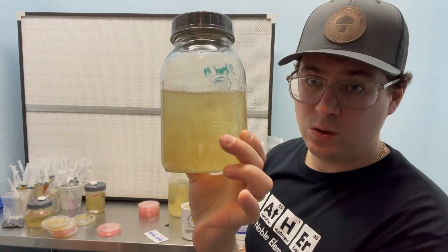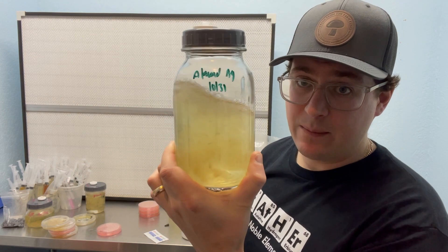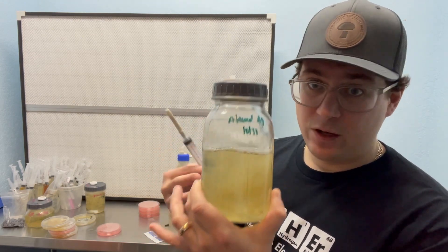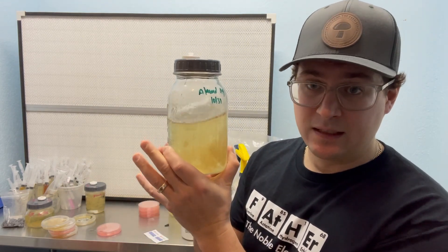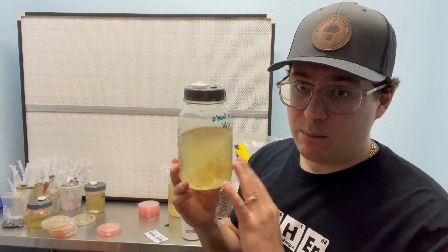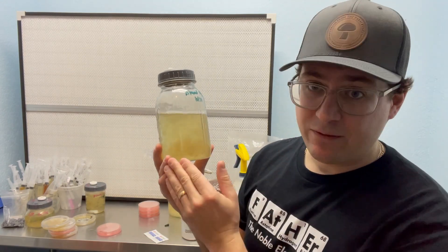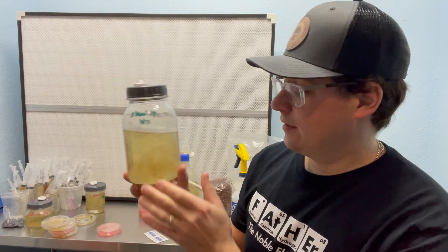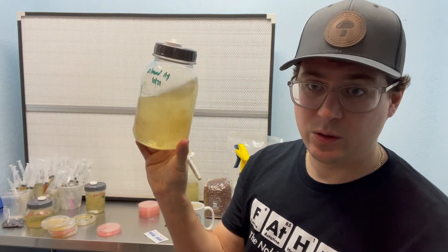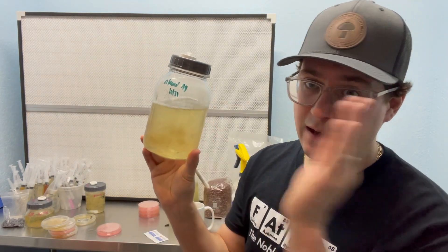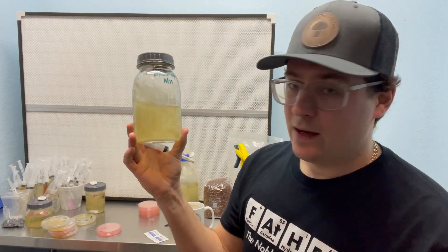Now, if you put two liquid cultures together in the same media bottle, they're going to compete for nutrients. You're going to get a big mess. Sometimes people think that you can breed mushrooms that way, but you have to use haploid cultures. So right now I kind of just ruined that jar, but I'm going to be making a fresh batch right after this video anyway. So I don't mind doing that.